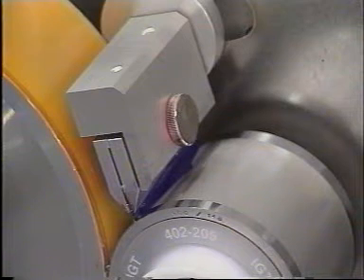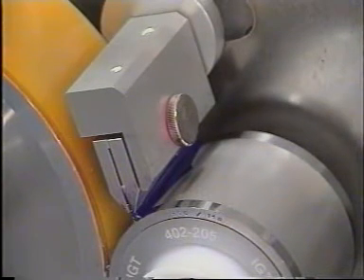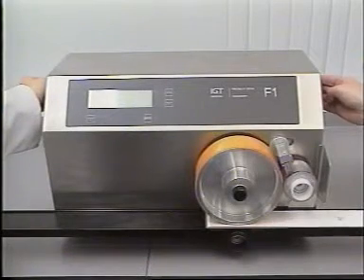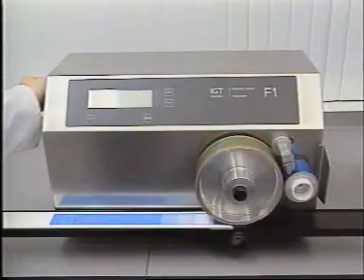During this operation, one of the two buttons on the machine is kept depressed. The print is made by depressing the second button.